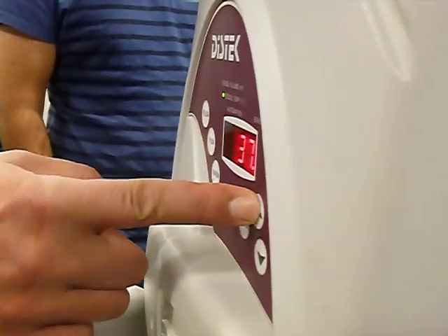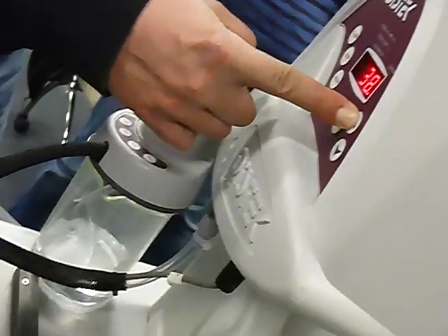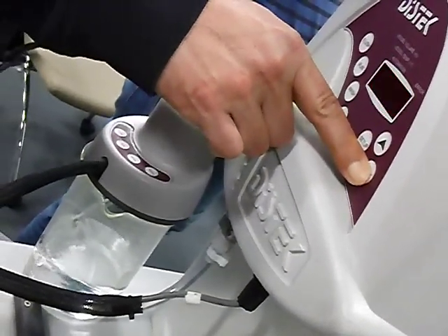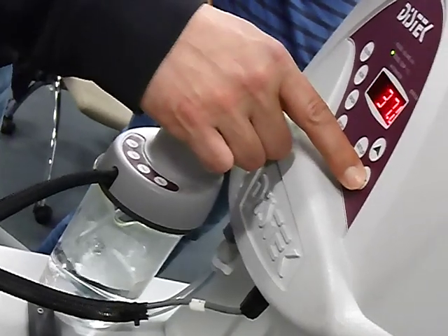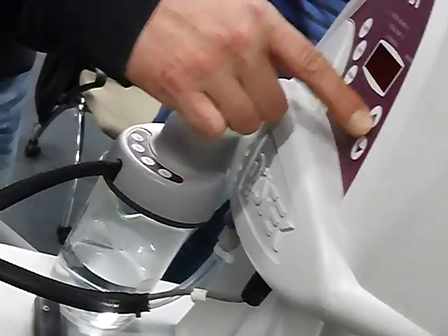What about your stop? Check something. So the gas should leave the medium and stay in the top, yes? Yes. Cannot change anything now. That should be the idea. Yeah. We don't have a vacuum.